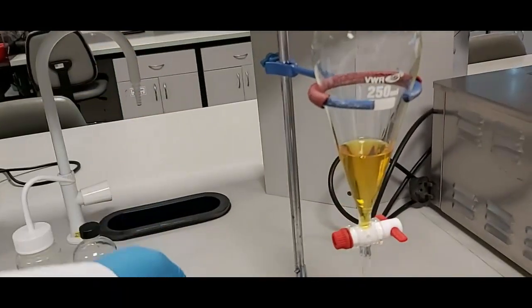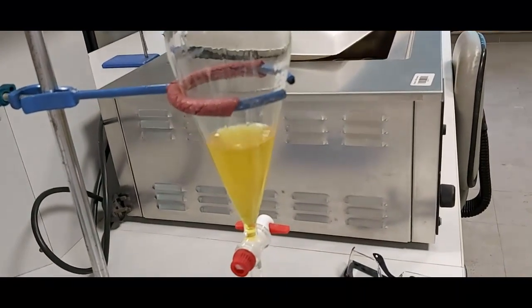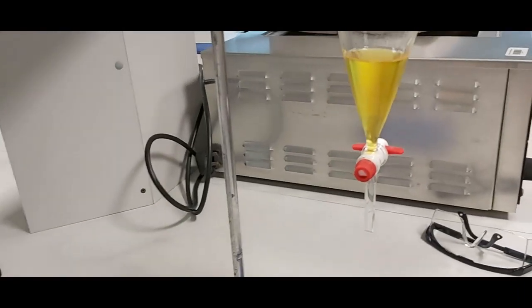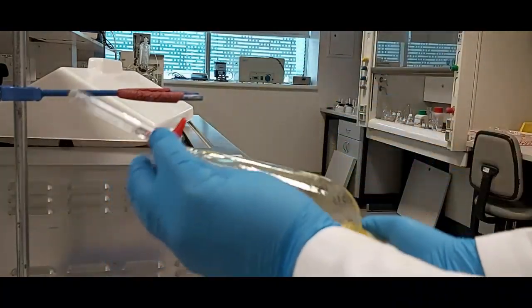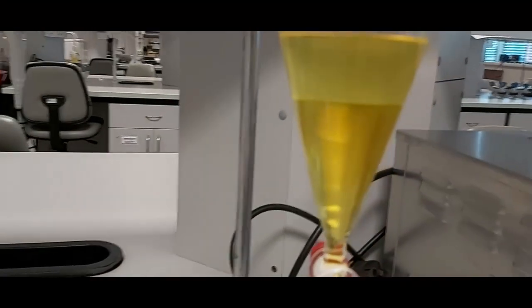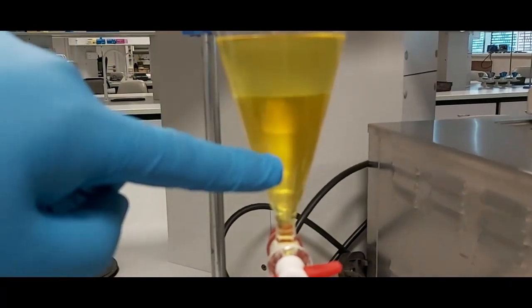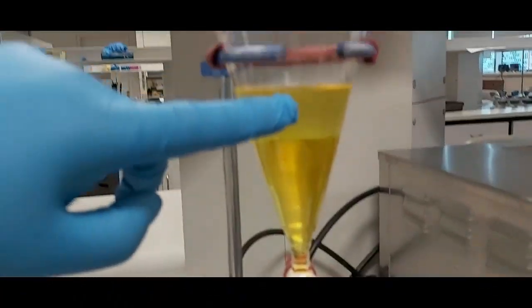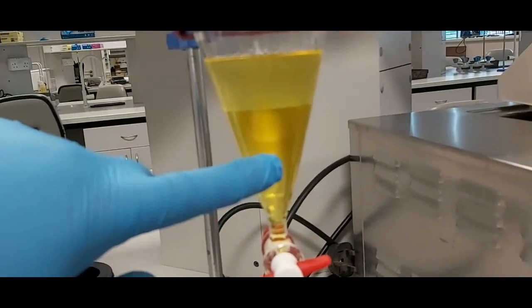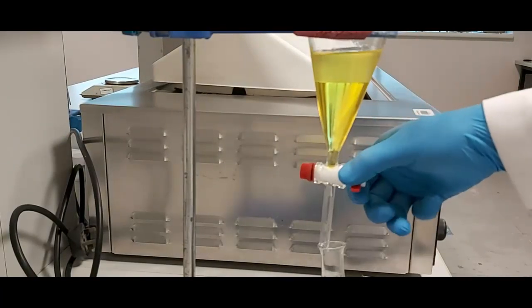I will add 20 ml of diethyl ether to the mixture solution and close the separatory funnel to do the extraction. As you can see, there are now two phases: the upper ether phase and the lower water phase. We take the ether layer — it contains our product. The water layer contains the impurities, and we will wash it again with ether, performing the extraction two times.